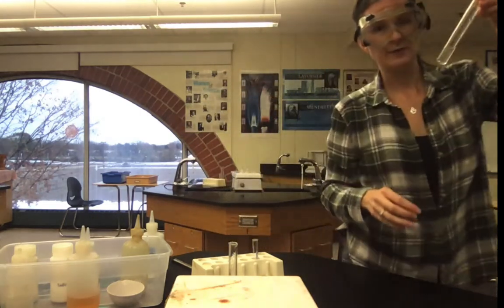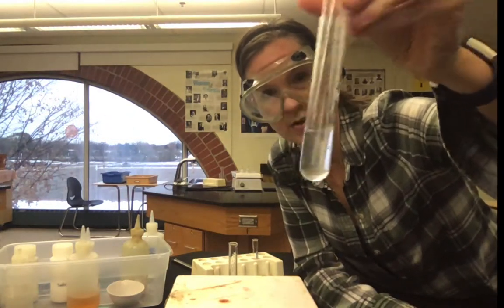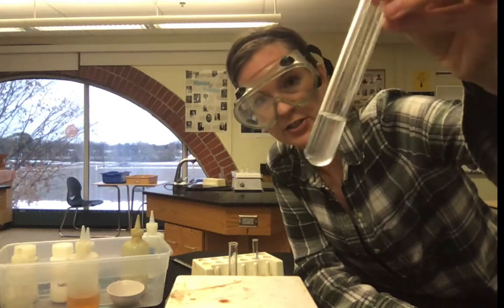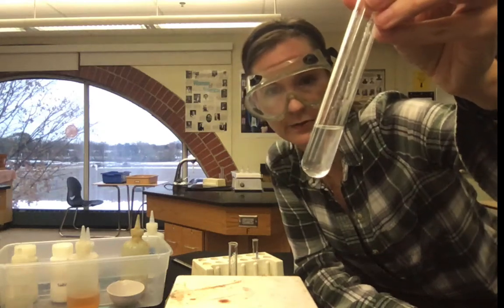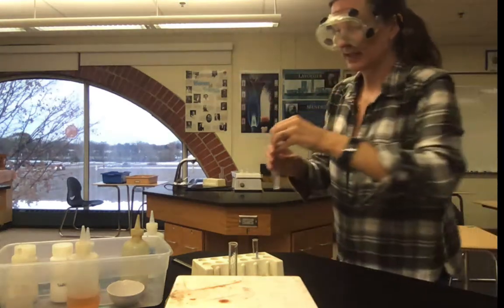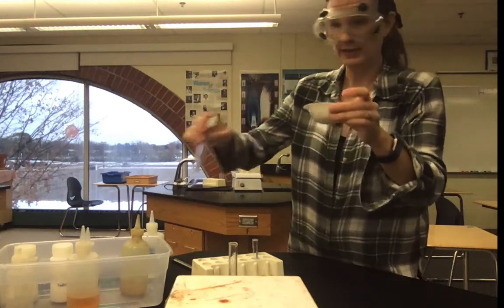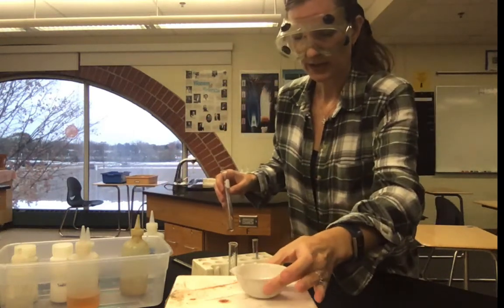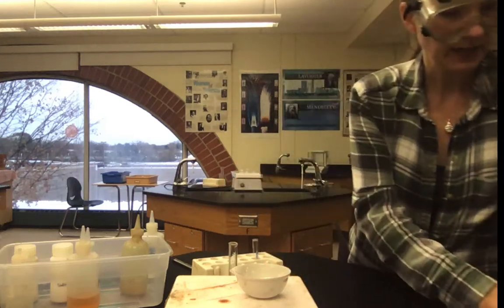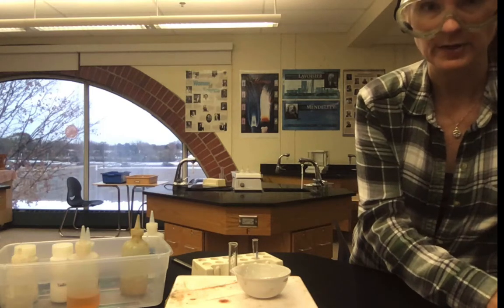So if you want to make observations about the two substances together, it looks as though we don't have the sodium chloride anymore. It's disappeared, and we're back to just what the water looked like before. To finish this experiment, we're going to take this liquid, pour it into an evaporating dish, so this little tiny dish. We're actually going to heat this up. After it's dry again, I'll show you what that experiment looks like.